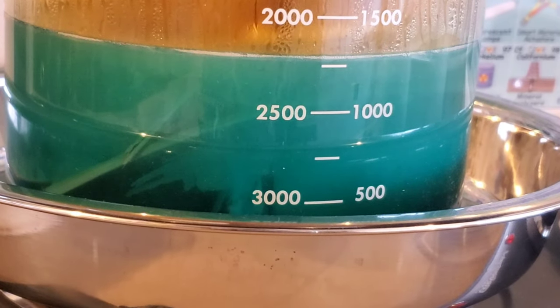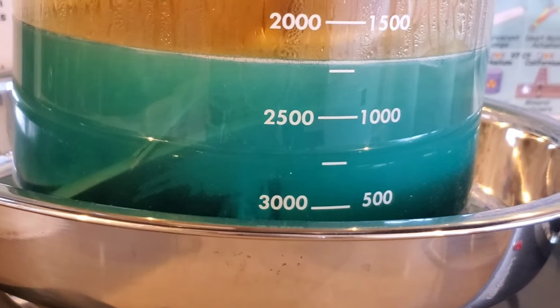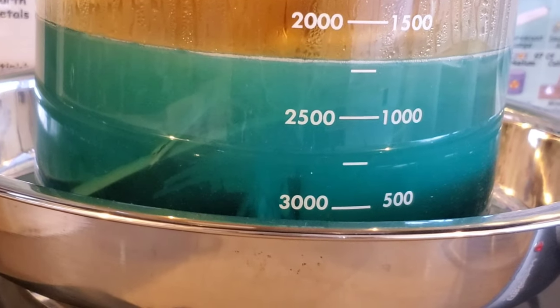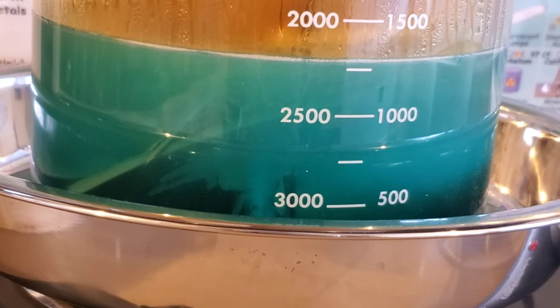It's been about 10 minutes since I added that diluted nitric acid. And you can see that it really sped up the refining process or the reaction here.